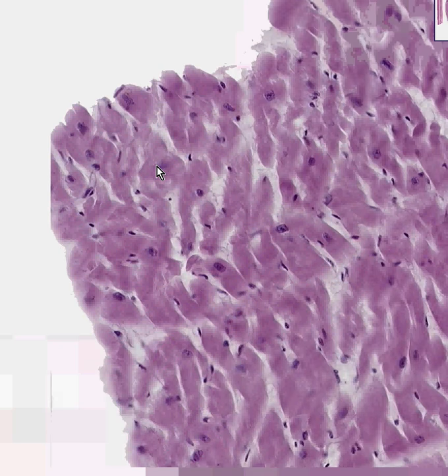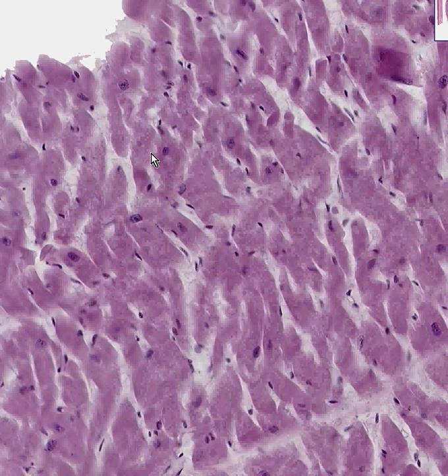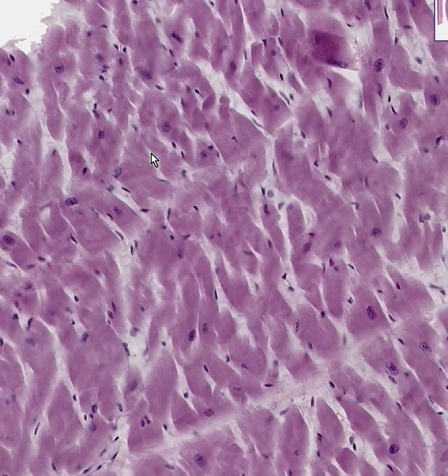Let's keep on moving away now from these nice smooth muscle fibers and go on to our third type of muscle, which we are going to be seeing very soon, I hope. And sure, we have just landed on the coast here, and we can start to see some muscle fibers now in which I think you will admit it's a little bit more difficult to see the striations. Let's go to a different area. Maybe we'll see some striations better.